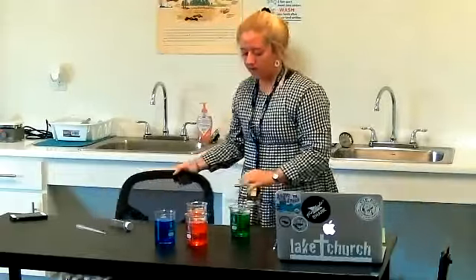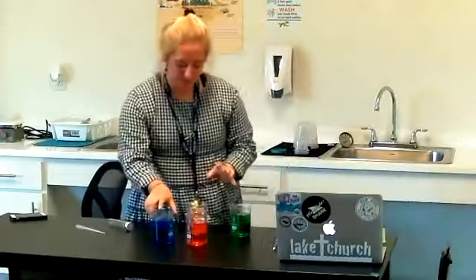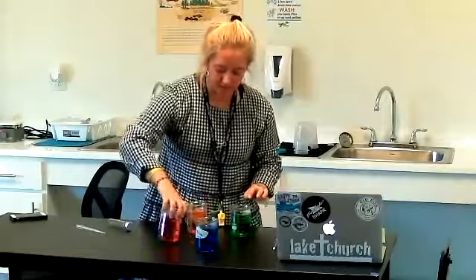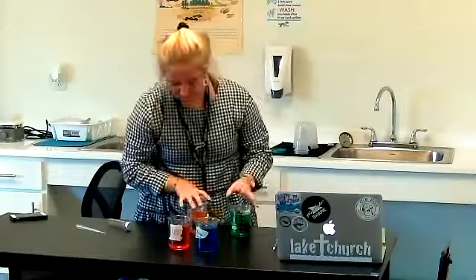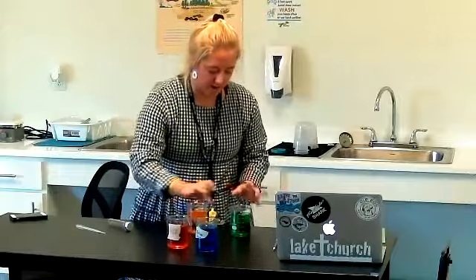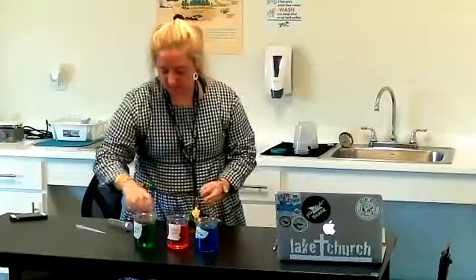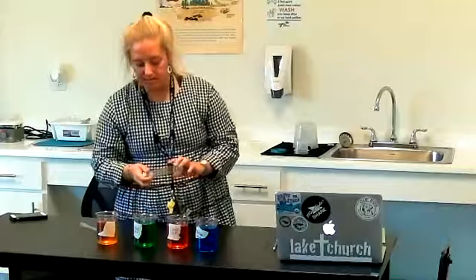We've got different colors of water. They're just water, but they have different amounts of salt in them. My blue has three moles of salt, my red has two moles of salt, my green has one mole of salt, and my yellow and orange does not have any salt at all.